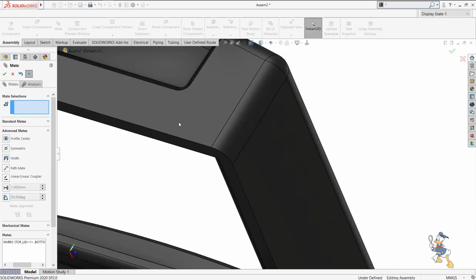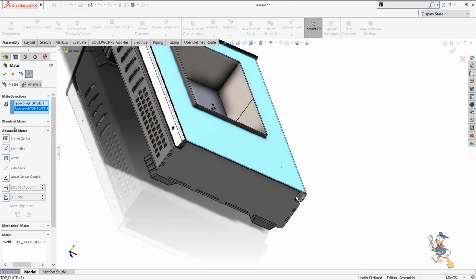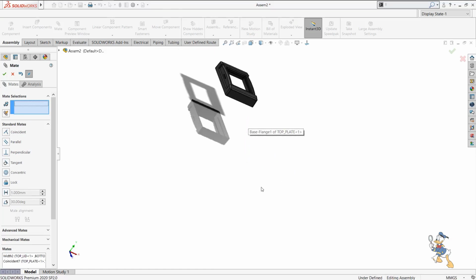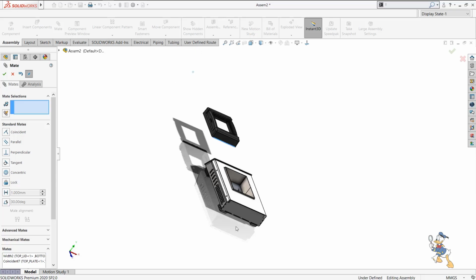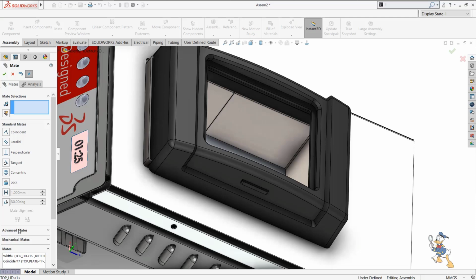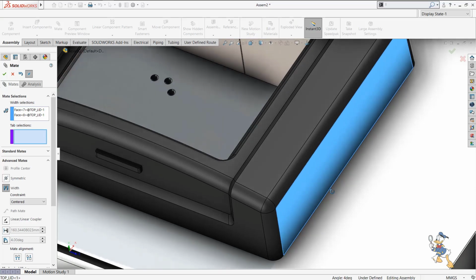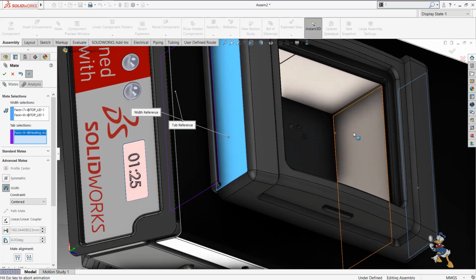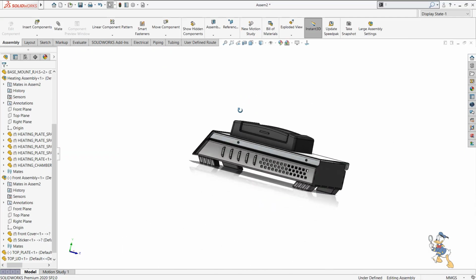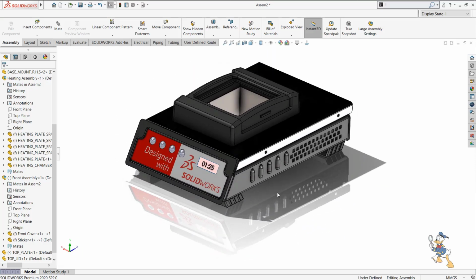And then I just need to make a coincident mate to the face of this, so I just need to select the coincident feature over here, and if I make it coincident, I just need to drag it over here. Look, am I doing it right or not? And then I just need to do some more width mates as well, so I just need to select these two faces, and suppose I just need to mate with this reference. So I have placed this one here, and now for designing purposes, we have assembled this feature.